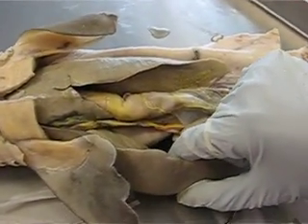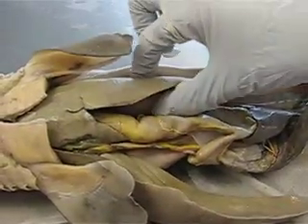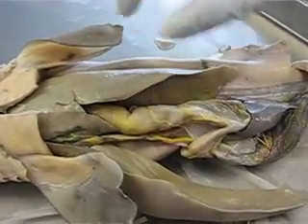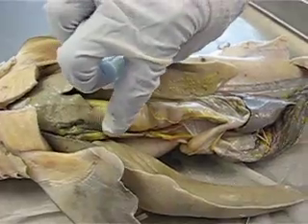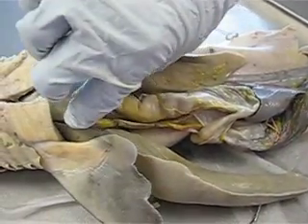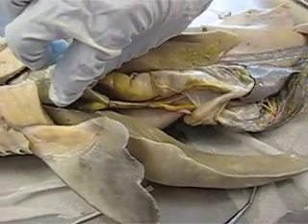Here's the right lobe of the liver, and here's the left lobe. Here's the median lobe of the liver, and the gallbladder is part of this median lobe — it's just this little nubby.